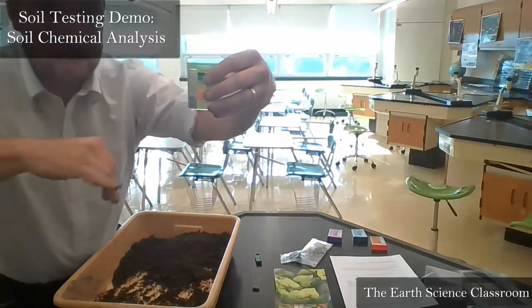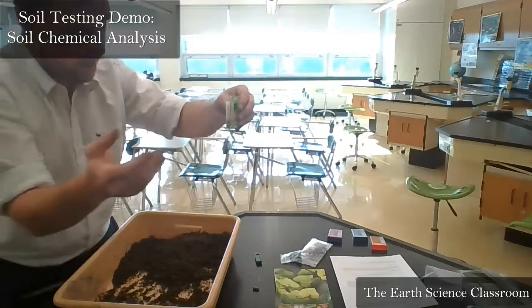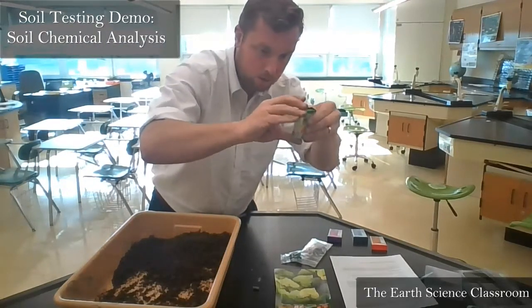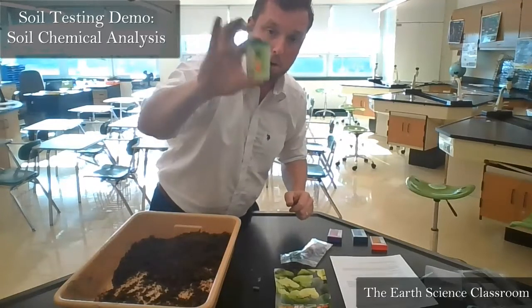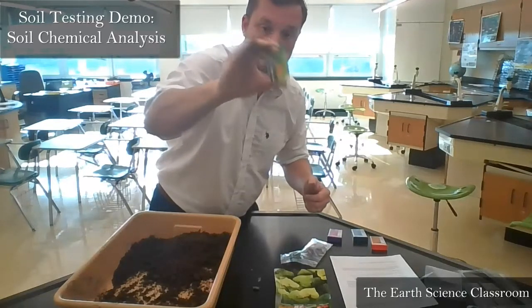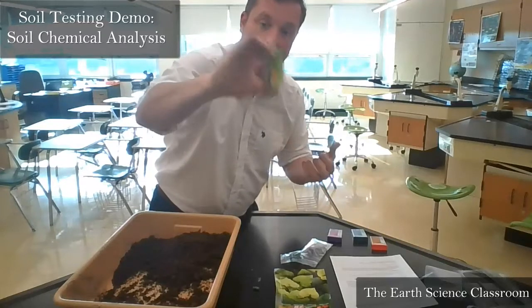Like that, okay? So we've got the water here, soil and the chemical. Now again, we put back the lid on top, make sure the lid's on properly, and we hold it like this, thumb and forefinger. We hold it and we shake. We shake for 30 seconds, again, so we can mix the soil and the chemical indicator and the water.